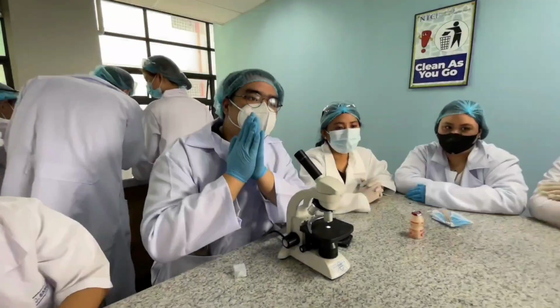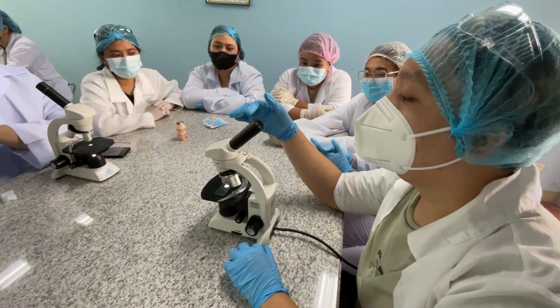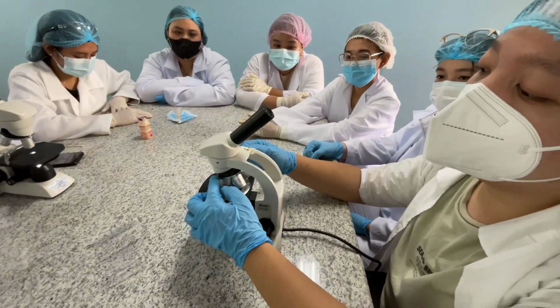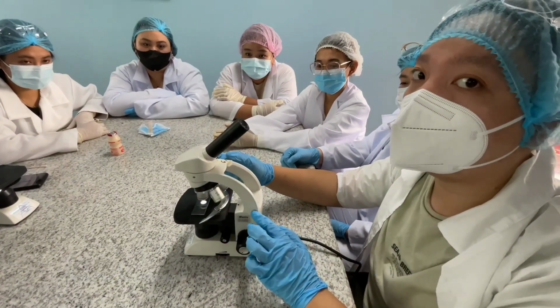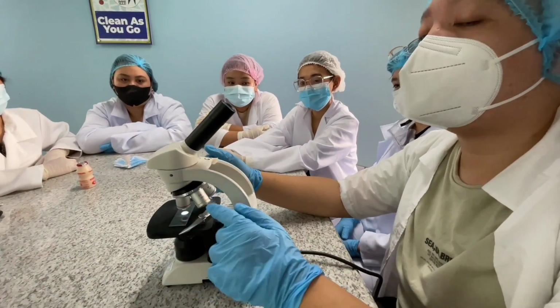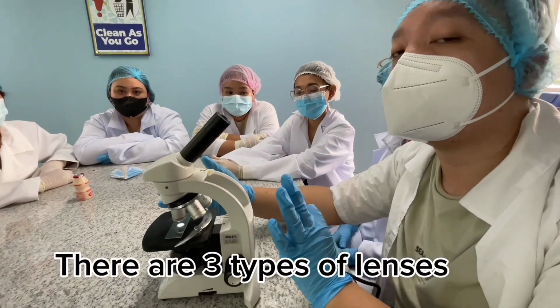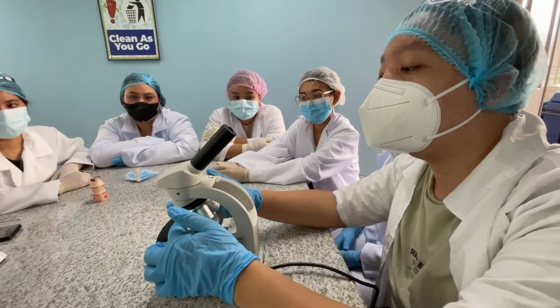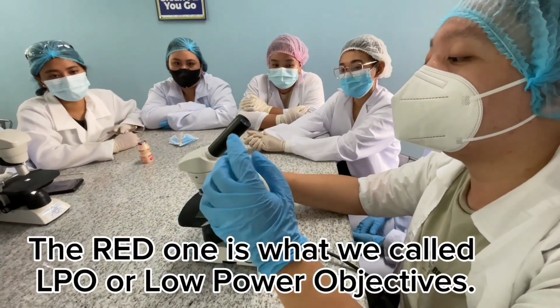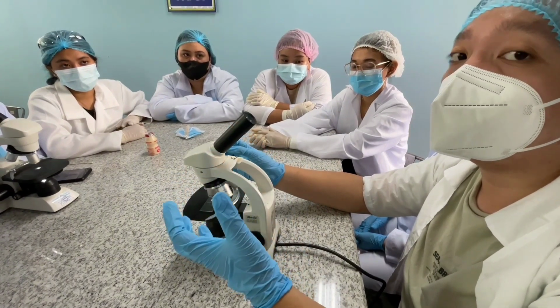Okay. Now, moving along, after you find out how you use the eyepiece, is for us to find out what these components here are. So the circular disc is what we call the turret or the revolving nose piece. And holding the revolving nose piece are the objective lenses. So as you can see, there are 3 types of lenses that we have here. So the red one is what we call the LPO or the low-powered objective lens, which is most likely for general use and also for magnification at low power.